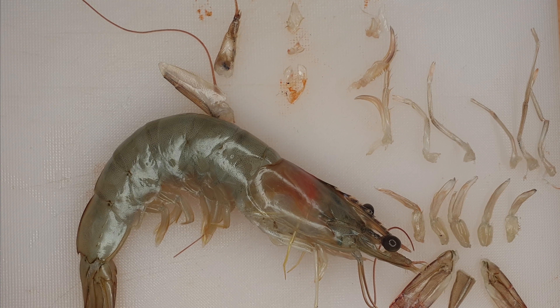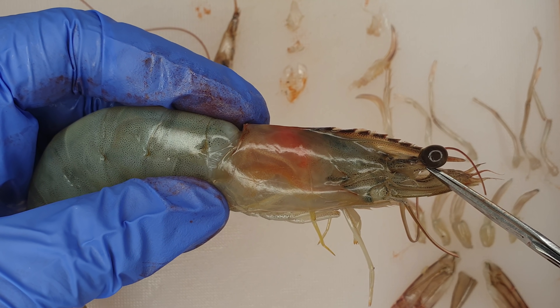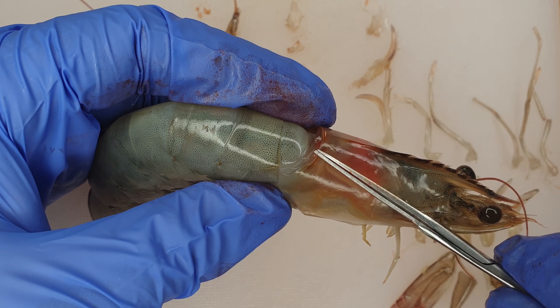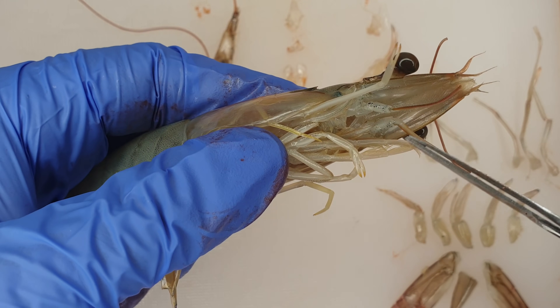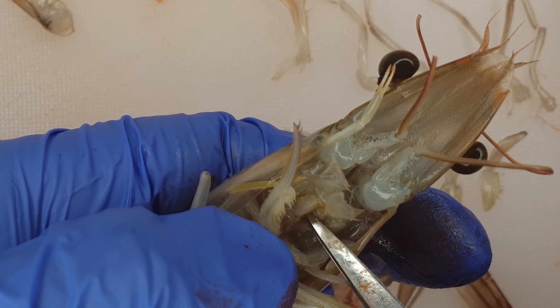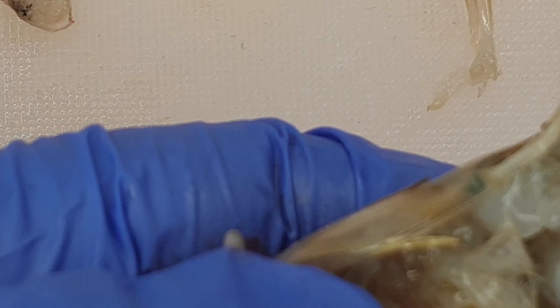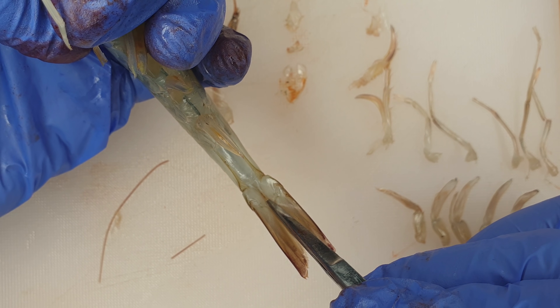Regarding internal structures: this is the head, and the eye is held by a stalk. Here is the stomach, and here is the hepatopancreas through which lipids and digestive enzymes are secreted. The mandibles open into the mouth opening, which opens into the esophagus, then the stomach, then the intestine, which runs through the abdomen and ends at the anal opening.